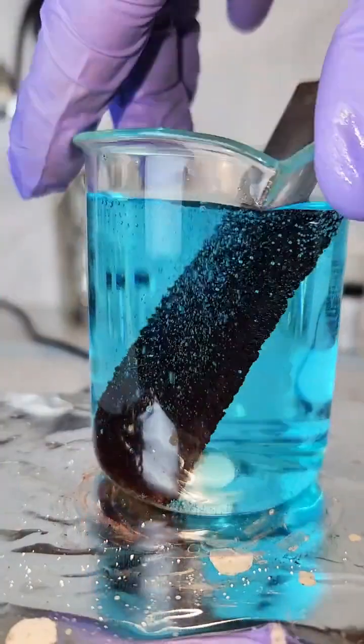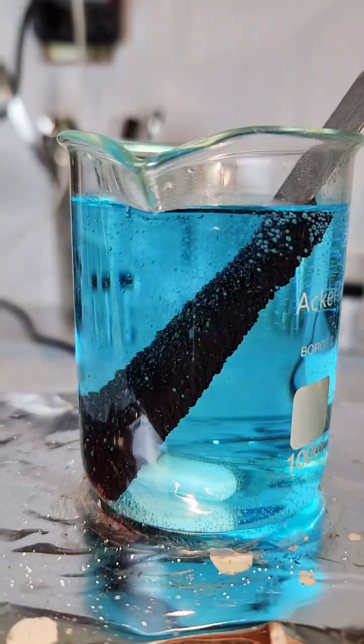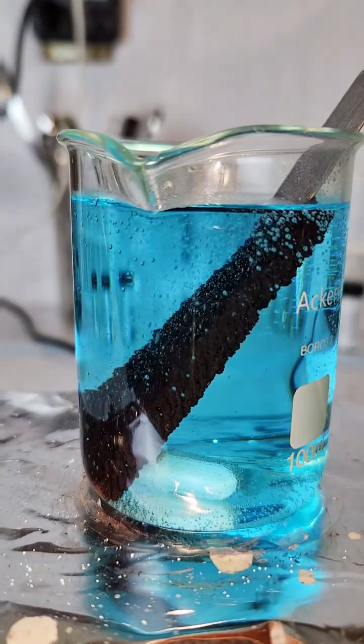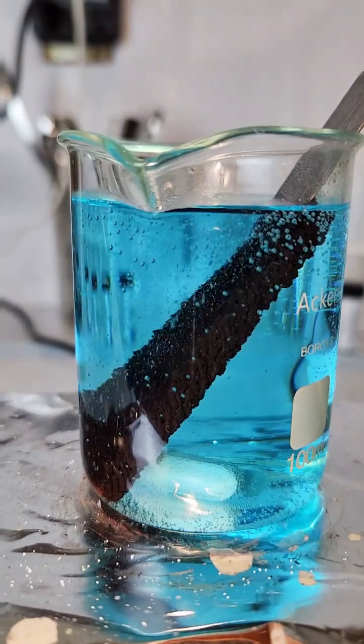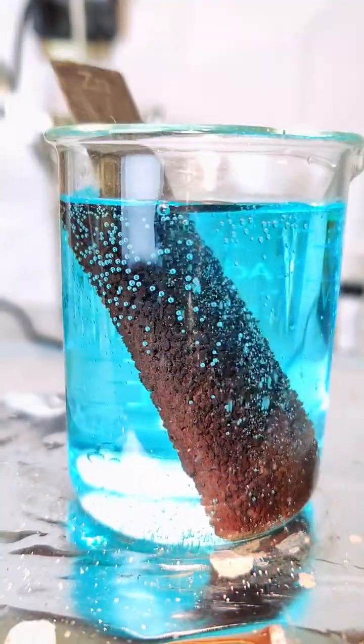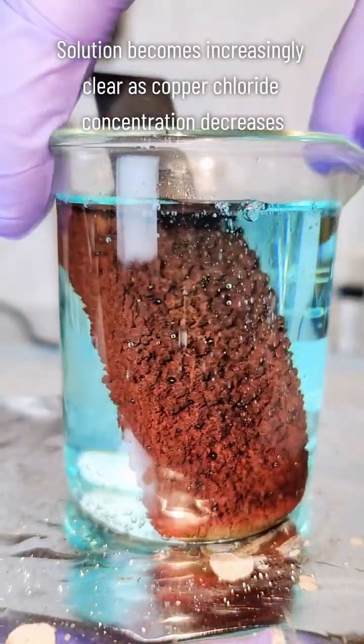I like this reaction between copper chloride and zinc metal because it demonstrates very simply a reaction I've done many times on this channel, for example to isolate nickel, bromine, gold, silver, and many other things. This is also the primary reaction used in batteries, which makes it infinitely useful to our everyday life.